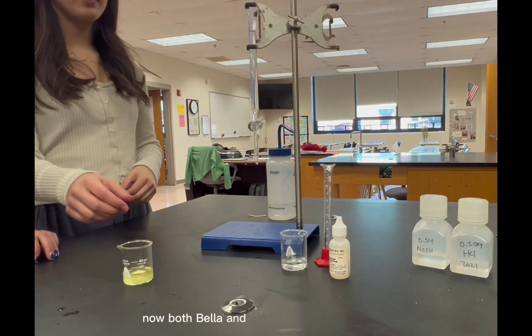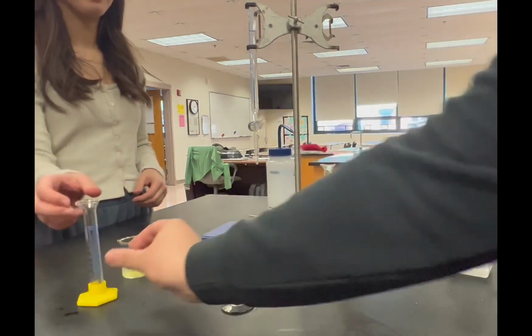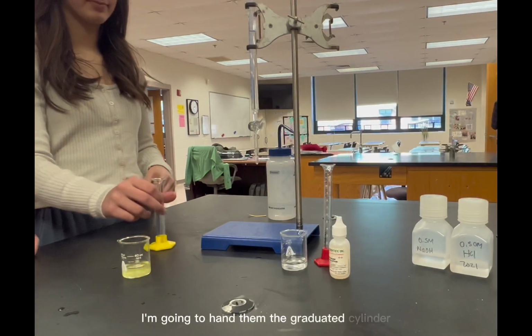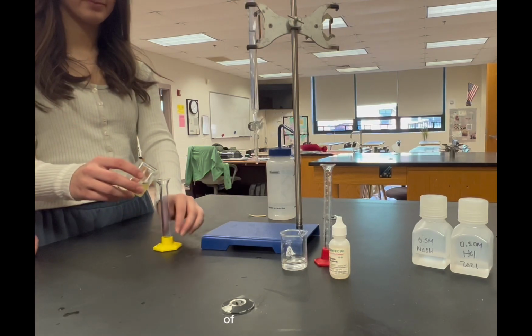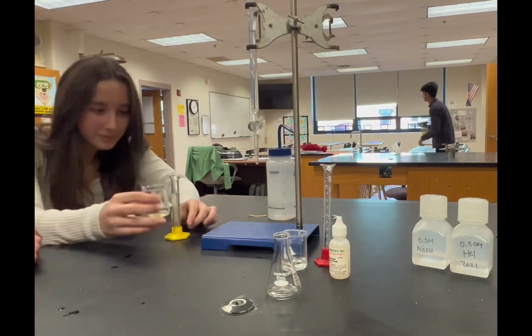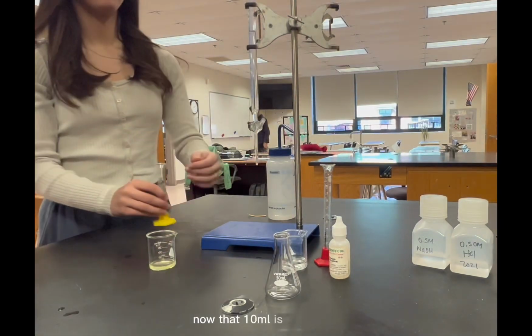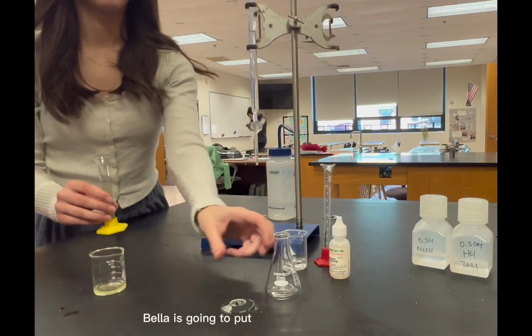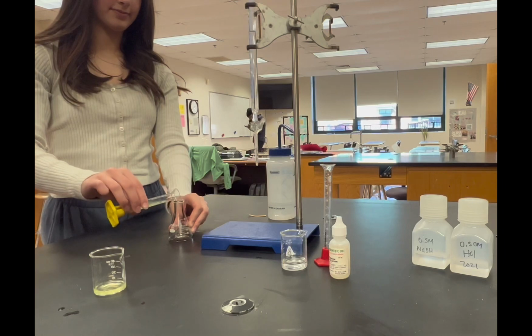Now both Bella and Nina are going to perform the titration for Gatorade Lemon. I'm going to hand them the graduated cylinder, and they are going to measure out exactly 10 milliliters of the Gatorade. Now that 10 milliliters is measured, Bella is going to put the Gatorade in a flask and she's going to proceed with the titration.